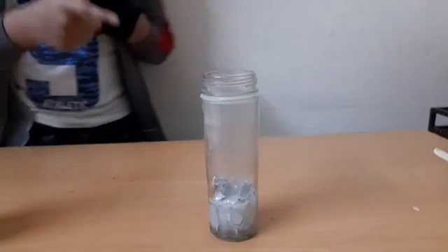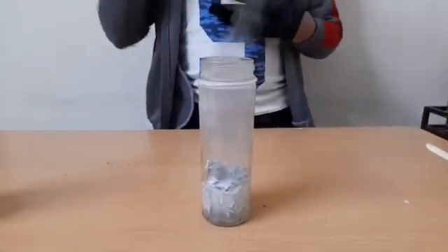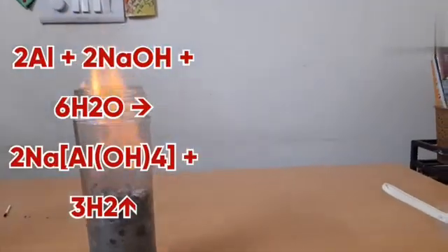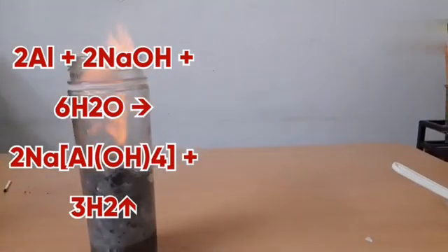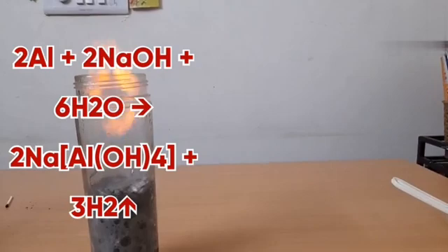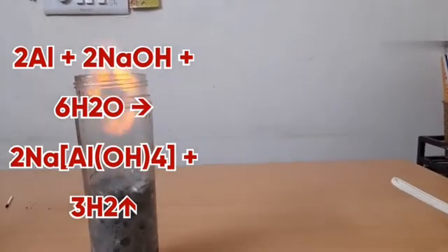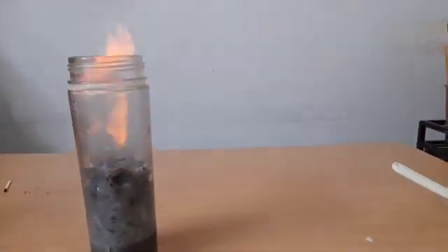Did you see that pop sound? That was only due to the presence of hydrogen. After I did this experiment one more time, you can see how the aluminum foil is boiling and fire is also produced. After that, when it blows out, water vapor is also there and the mixture becomes completely black in color. Thank you.